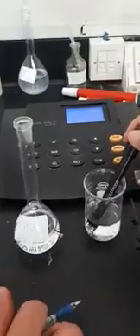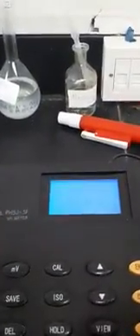Now we prepare the different pHs. We will work on pH 3.3, and the next pHs are done in the same manner. We have already prepared acetate buffer of pH 3.3, and we measure the pH. We take 20 ml of this buffer and put it in the beaker to measure the pH before addition. As seen on the pH meter reading, it is 3.37. I will record this reading: 3.37 — this is the pH before addition.